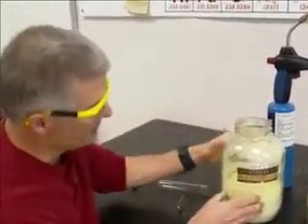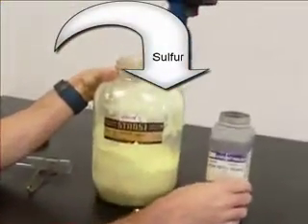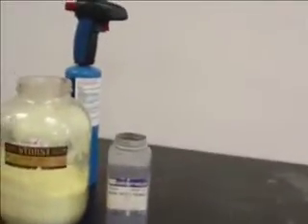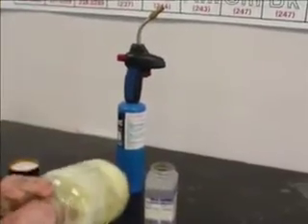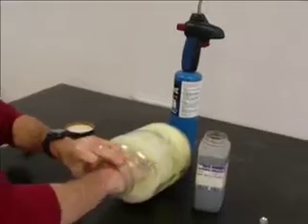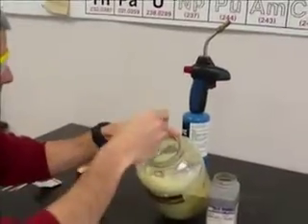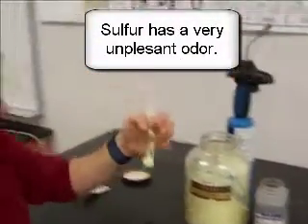All right, the reaction I'm going to work with is I have sulfur, elemental sulfur, right here, S. I think it's S8, isn't it, Mr. Sanders? It is. And I have iron metal. Okay, so what I'm going to do is I'm going to take this test tube and put some of my sulfur in. This is a good thing about sulfur, isn't it, Mr. Sanders? That is, but it smells lovely, doesn't it? Oh, woo! All right, so I have some sulfur in there, right?